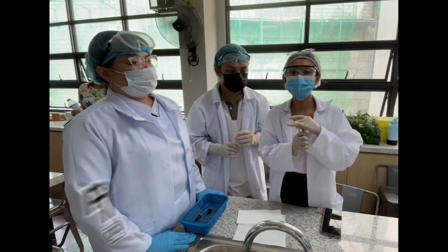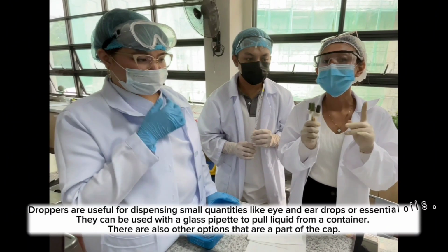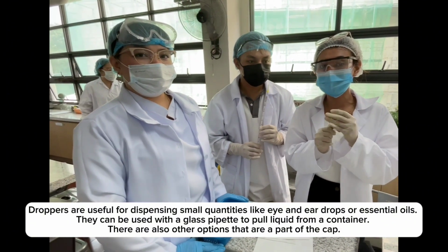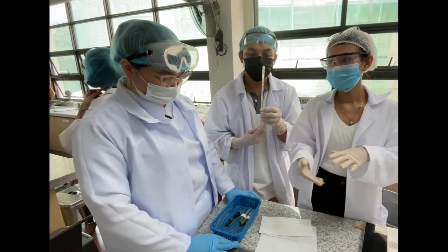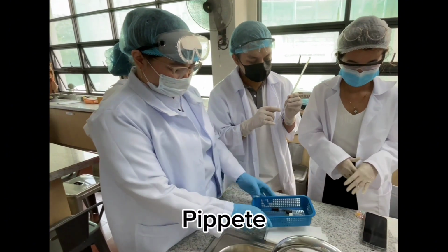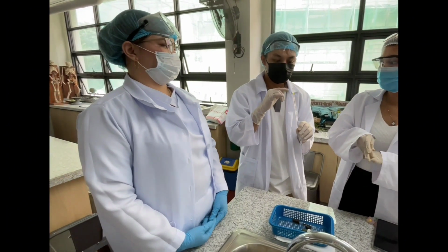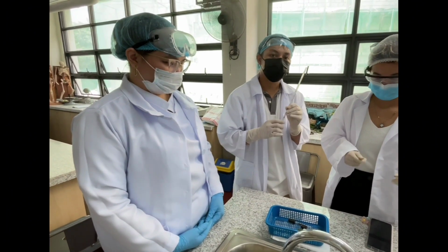This one is called a plastic dropper. Before, this one was made of rubber, but right now it is made with thermoplastic. And this one cannot be used with acids because the non-organic liquids can be dissolved in plastic. And lastly, to measure the liquids or chemicals that we use, we have pipettes. Pipettes have numbers that indicate the measurement of the liquid that you put in it. Actually, there are other equipments to be used since the hole in here is much smaller for the droplets. So that's all.